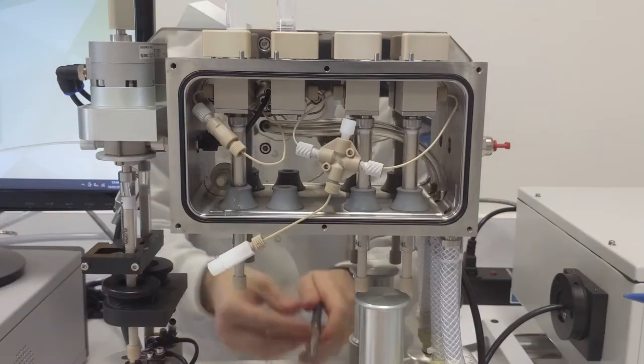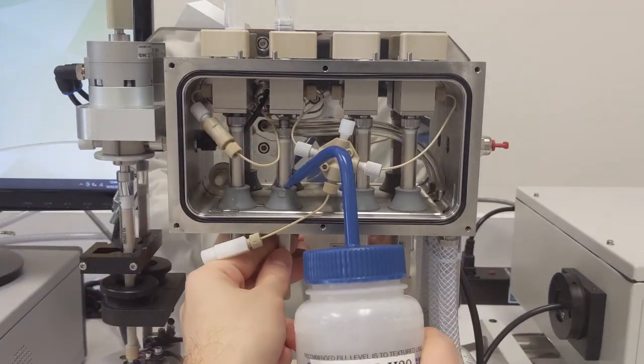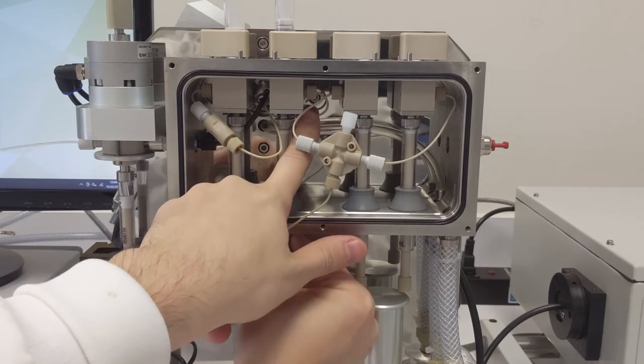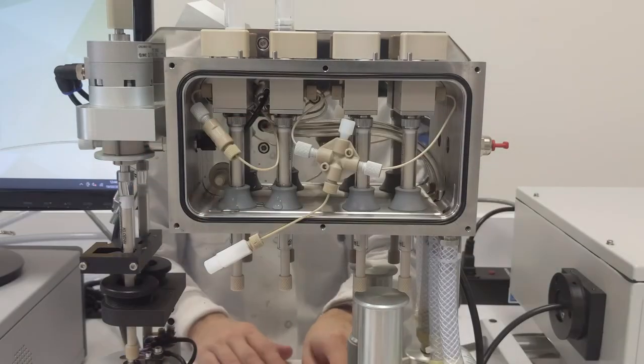Tightening syringe is also a good exercise if you want to improve blood circulation in your thumbs, so I occasionally do it just for kicks. But in order to ensure the tight fit, you can also use pliers with a light grip pressure to secure syringe in place.